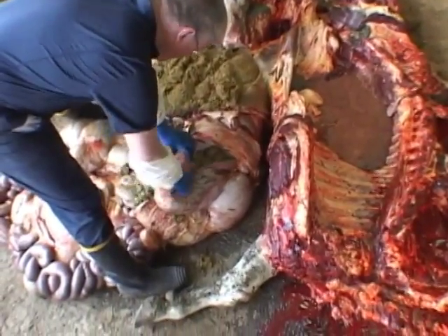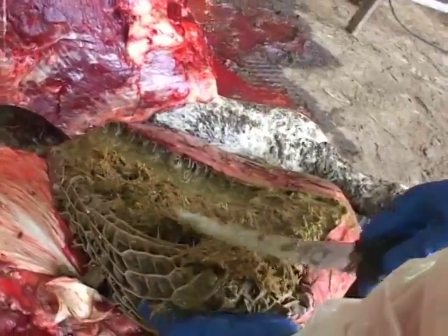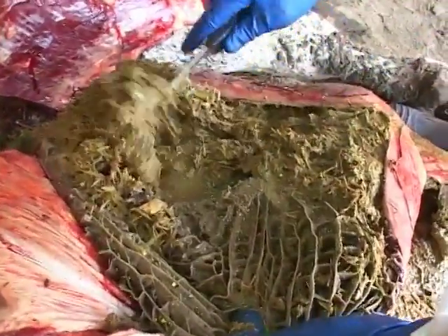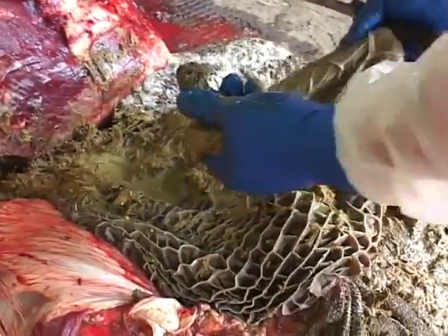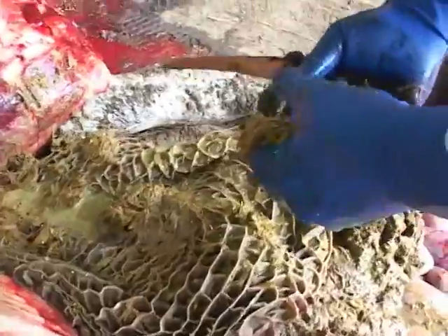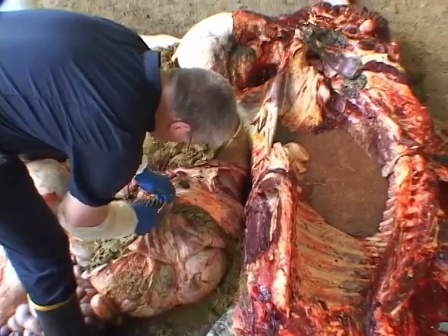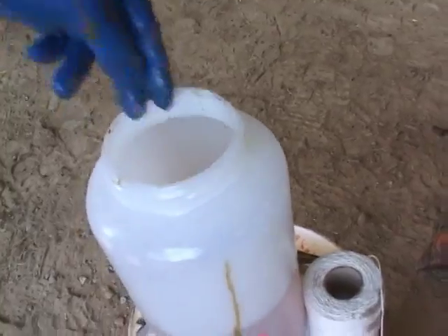Open the reticulum, remove some of the contents, and examine the mucosal surface. The normal mucosa has a honeycomb-like appearance. Foreign objects tend to accumulate within the reticulum. If the animal has been given a magnet, this is typically where it will be found. Collect a piece of reticulum and place it in the jar.